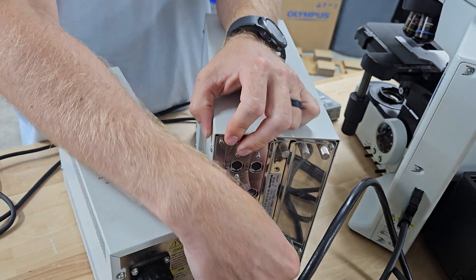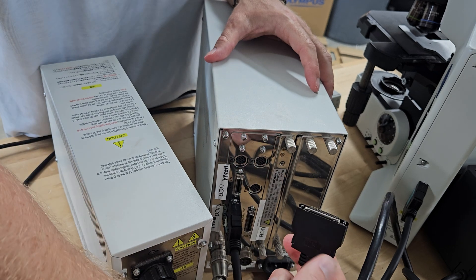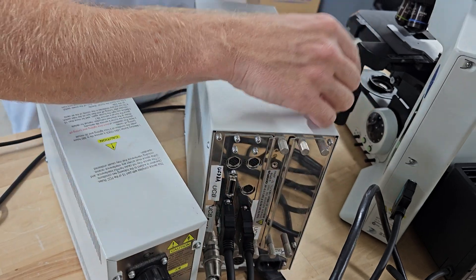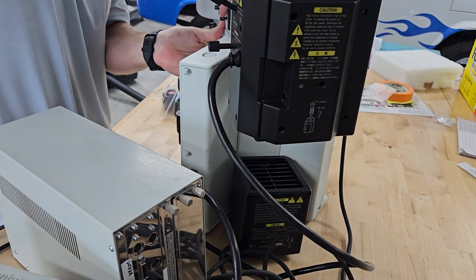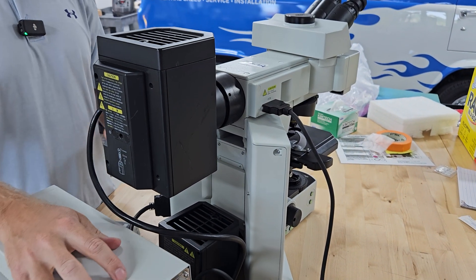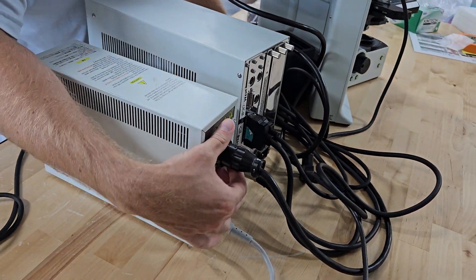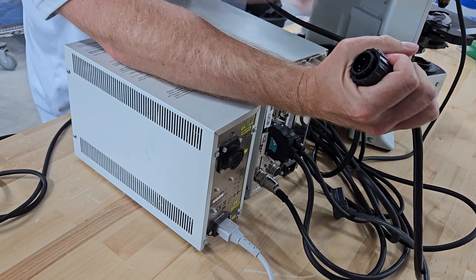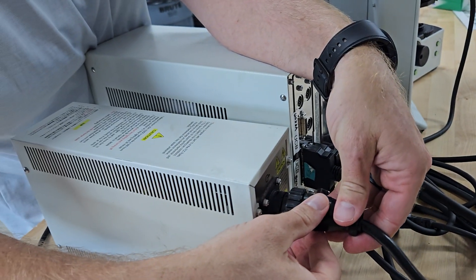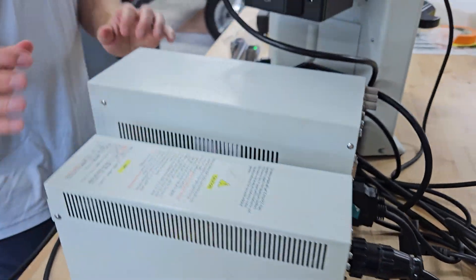If you don't hear it click, you could have issues. Make sure it's pushed in. To take it out, you want to match these two buttons and depress those two buttons right there. This one goes from here — spin it around — and it connects right here. Your mercury light source gets plugged in here. That's a twist connector. Notice that thicker prong right there — that goes to the top. So you've got to align it, then screw it in and it'll push in. That's basically it for assembly.